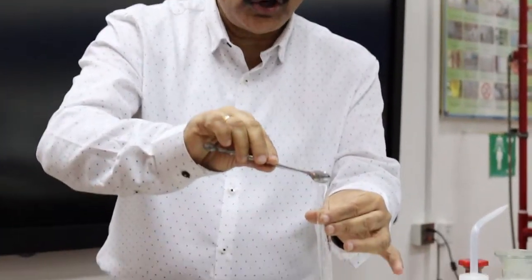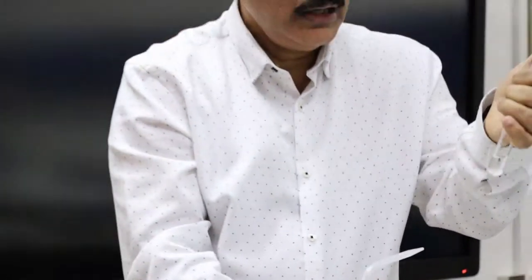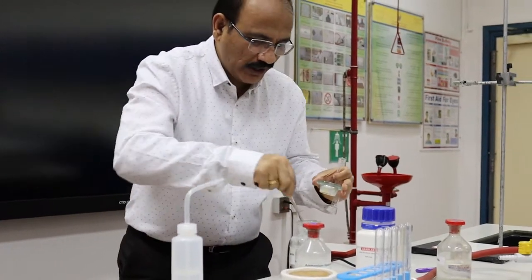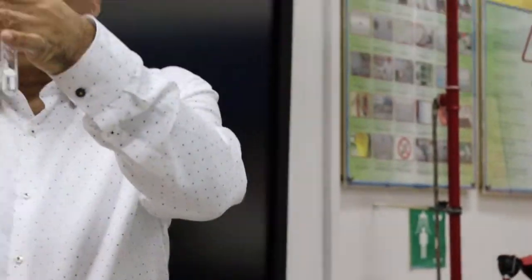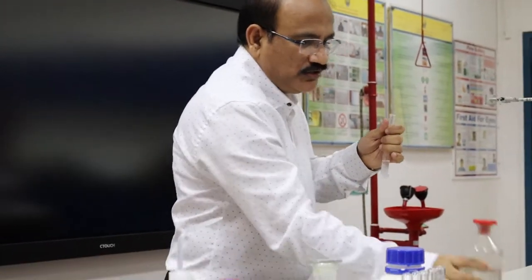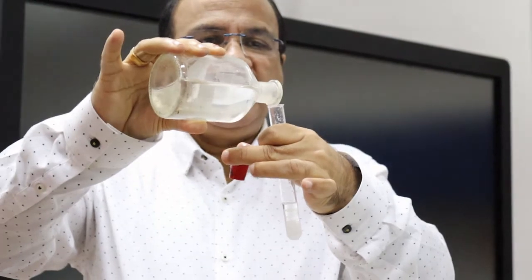Let us see the reactions of Zn2+. We will make the salt solution in water, and into that we will add the Group 4 reagents: ammonium chloride, then ammonium hydroxide, and then hydrogen sulfide solution. During the addition of hydrogen sulfide, we are getting a white precipitate.